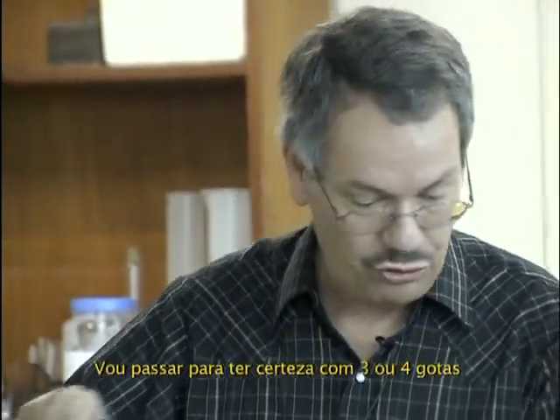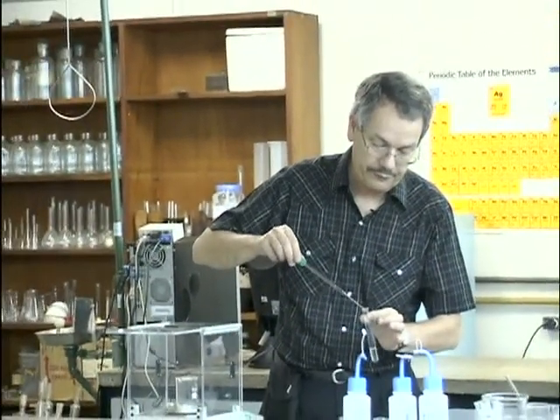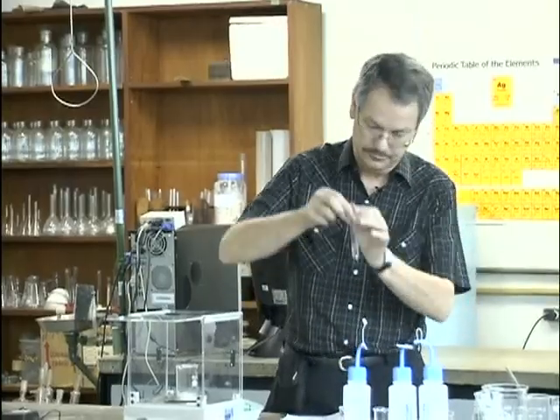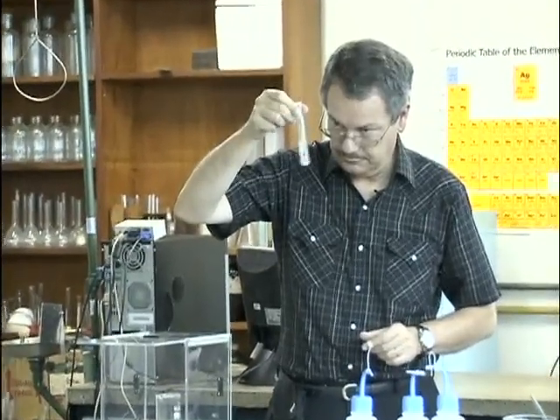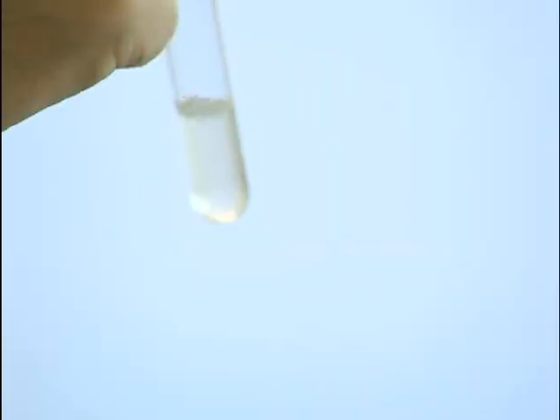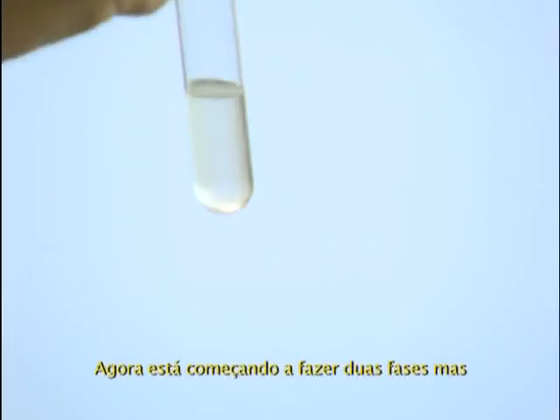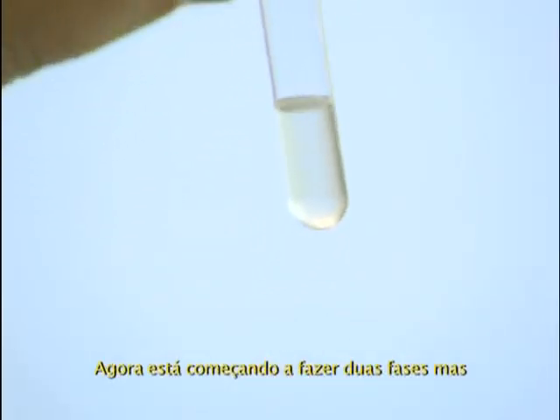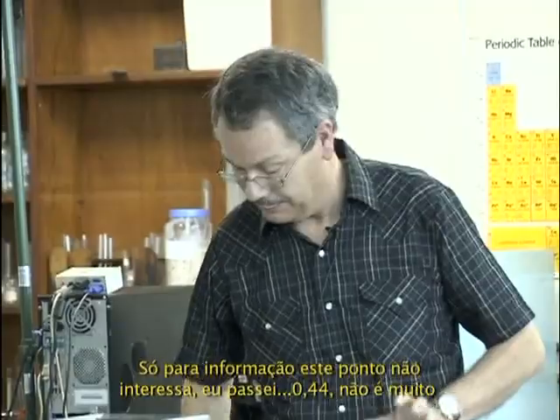I will pass it to be sure with 3 or 4 drops. And now it's starting to make 2 phases, but for information, this point has no interest.